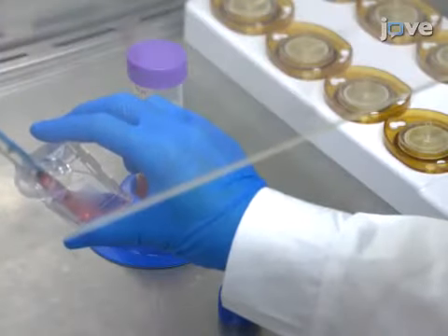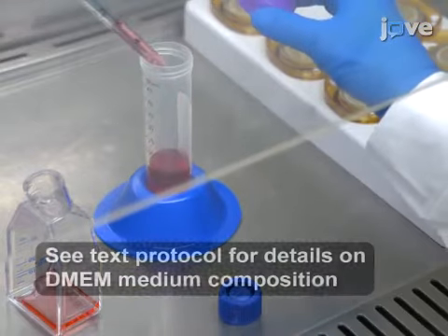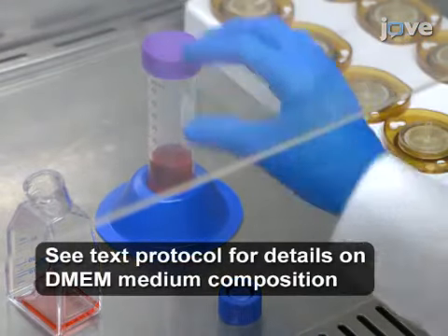Next, suspend 5 × 10⁴ U87 Mg cells in 1 ml of DMEM medium. The appropriate number of cells plated in each dish depends on the properties of the cell line in use. It is crucial to calibrate it prior to the experiment in order to avoid cell overgrowth.